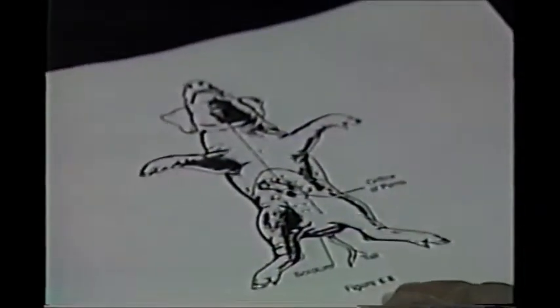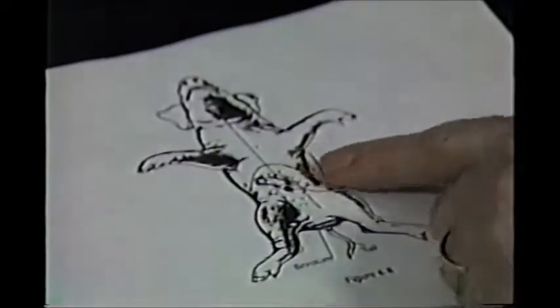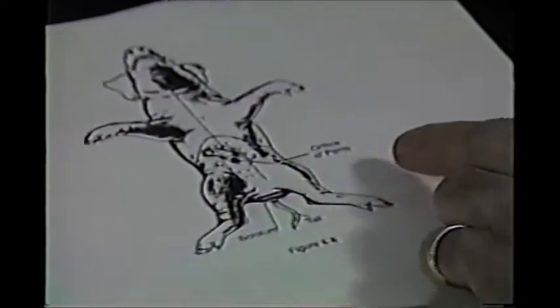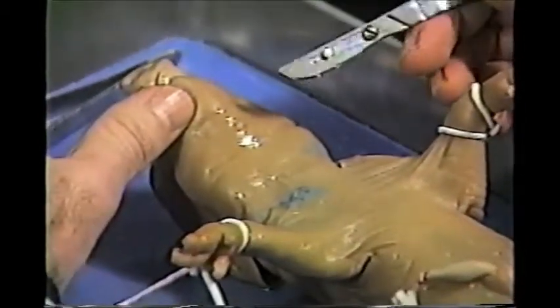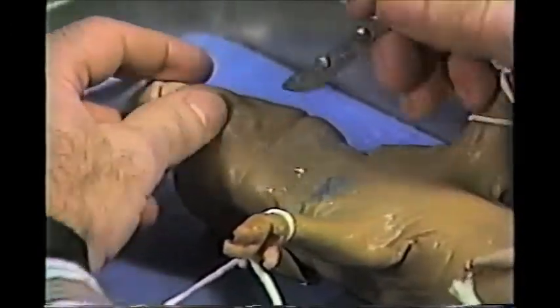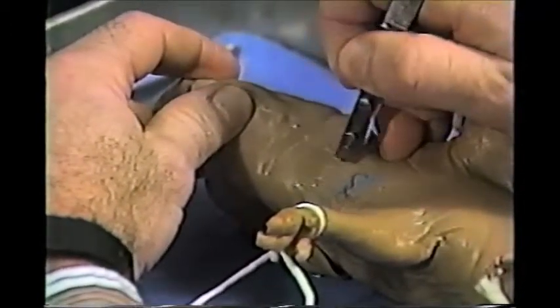You notice the pig is in the position on the dorsal surface, and the dotted line shows you where to cut. So we're going to take our scalpel, and there's a little mole here in the chin area with a few hairs. So yes, we're going to start at the hair of its chinny chin chin. We're going to take our scalpel, cut through the skin.